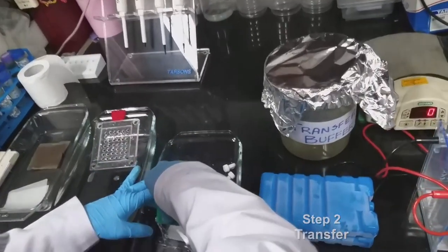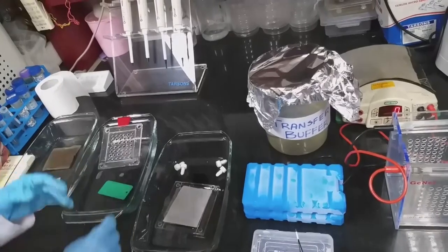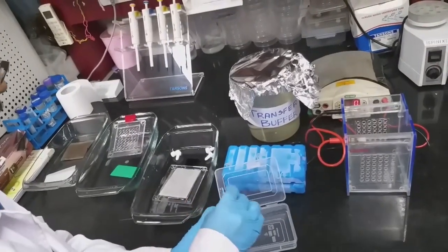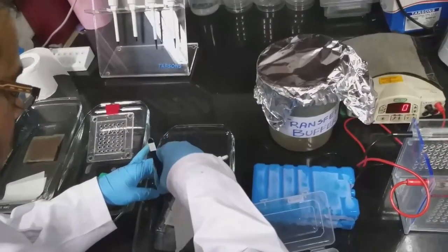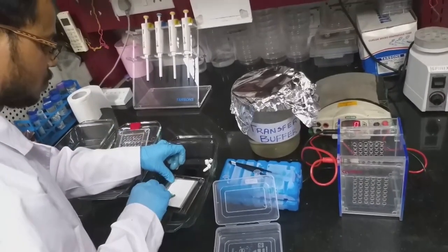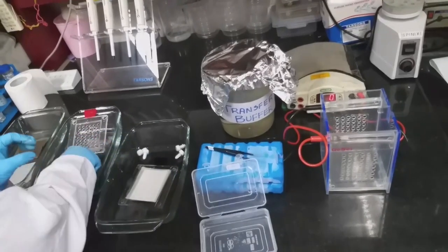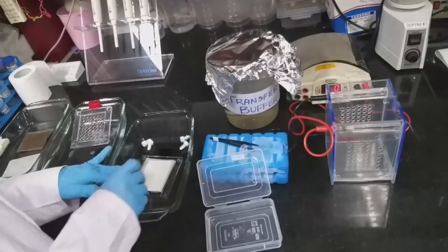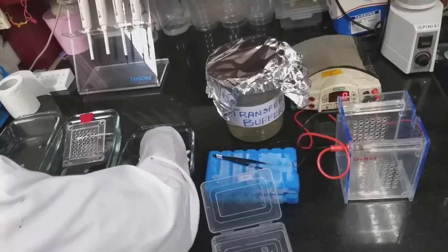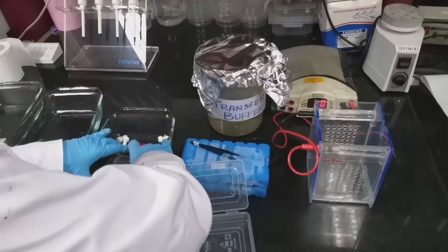After equilibrating the gel in transfer buffer, place it on the negative side of the cassette on top of the blotting sheet. Overlay with the PVDF membrane, remove air bubbles, overlay with another blotting sheet, and remove air bubbles again — air bubbles must be removed at every layer. Place the final blotting sheet, then close with the positive side of the cassette. Air between the gel and membrane will prevent protein transfer, so every bubble must be removed carefully.